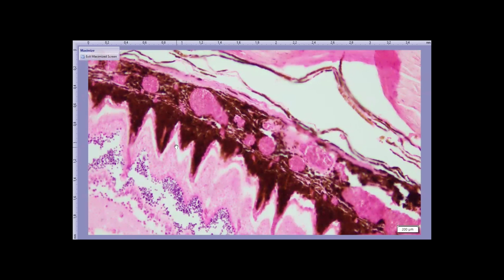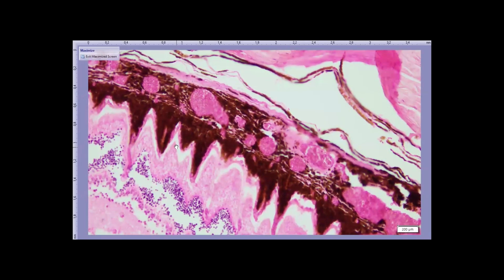And if we had a good specimen, you'd see that the retinal pigment epithelium cytoplasm is filled with foamy oil droplets, and those foamy oil droplets provide what we call a retinal tapetum, or in other words, a white tapetum, to reflect light back through the retina.